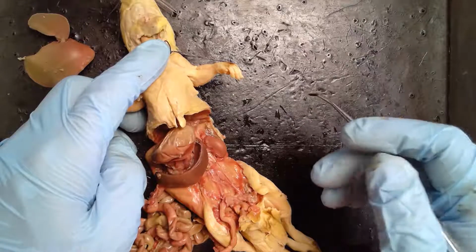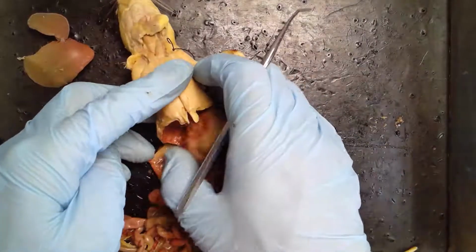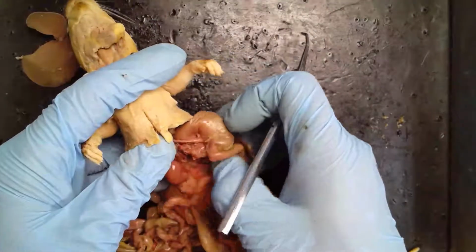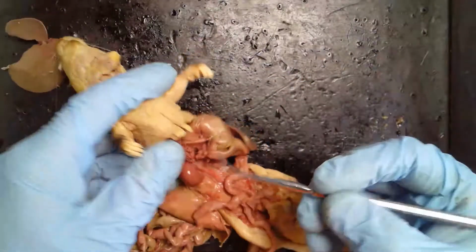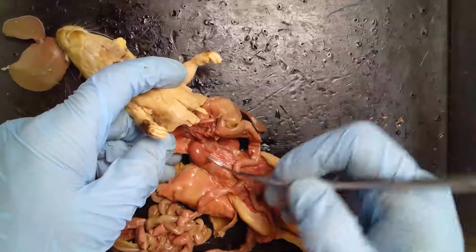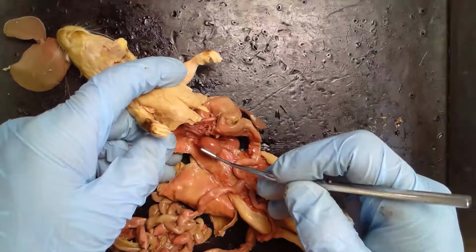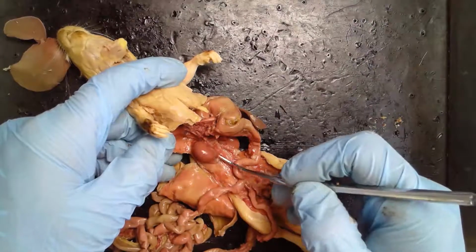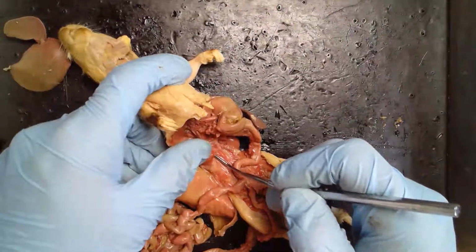Next, we're going to look at the excretory system of the rat. So we're going to look at the kidney. The kidney is, of course, on both sides, so it's bilateral. What you'll notice is that it actually has a membrane. I've sort of broken the membrane away a little bit, covering it. And that sort of glues it, in a sense, to the back of the animal, on the inside.